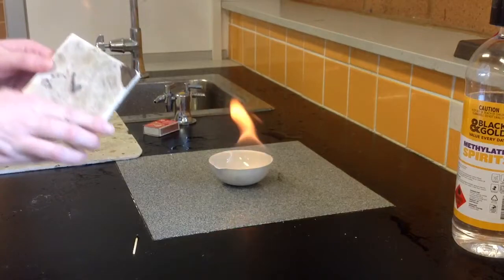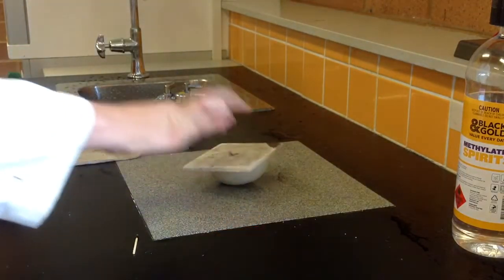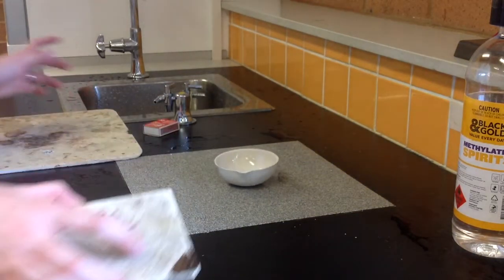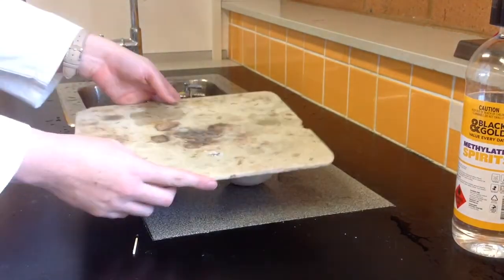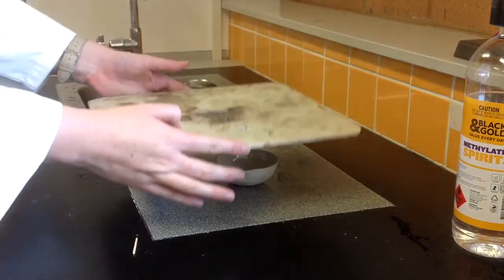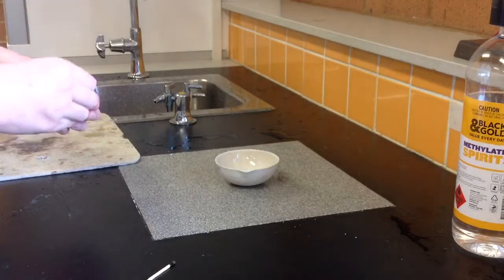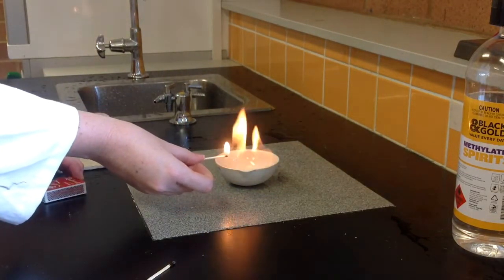An important thing we do is get our heat mat and practice putting it on top to smother and put out the fire. I always make a point that if it spills, just stand back, let me know, and come over and cover it with a bigger heat mat. If the bench, for example, goes on fire, just put a big heat mat over it. Everyone loves lighting fires, but it's important to know how to be safe with it.